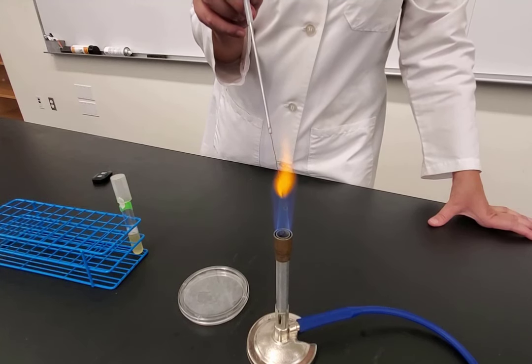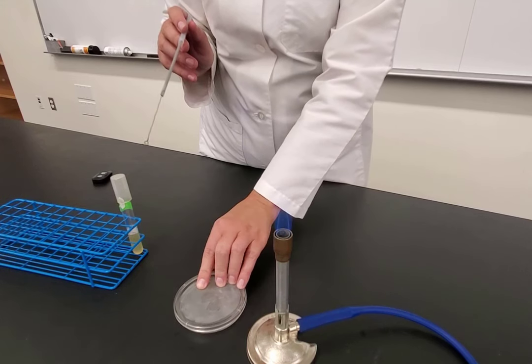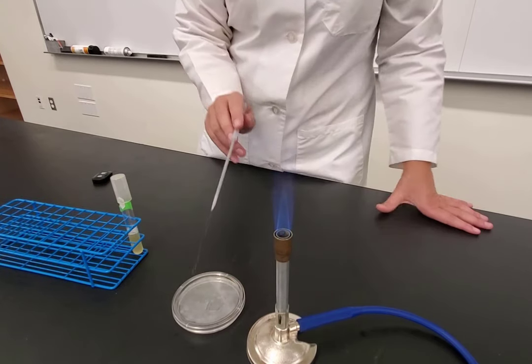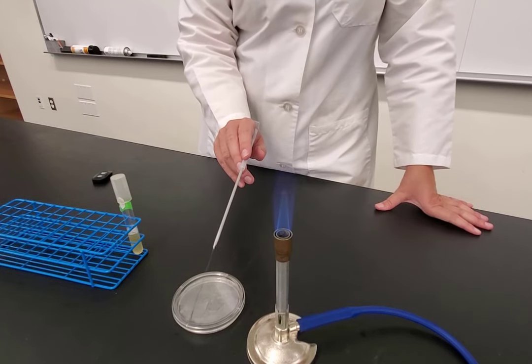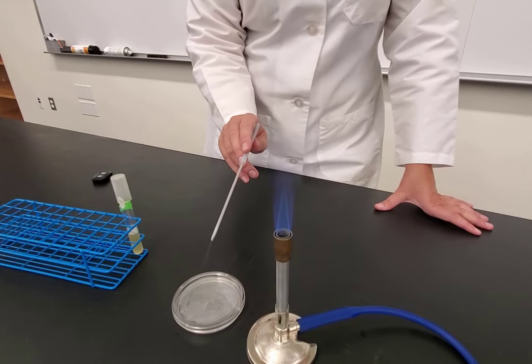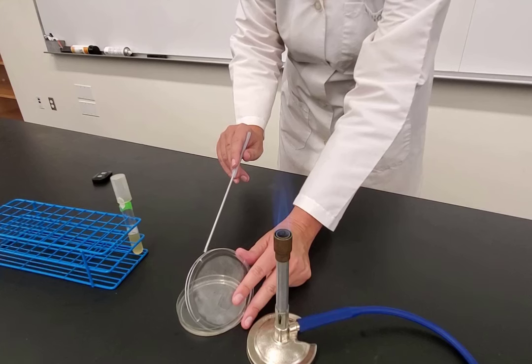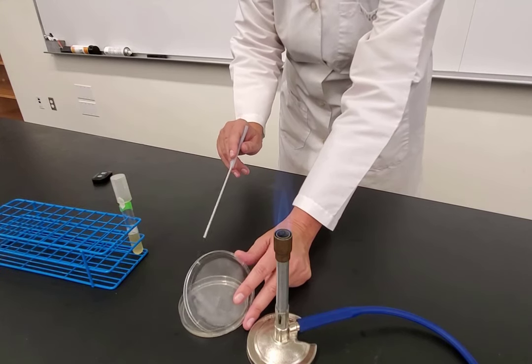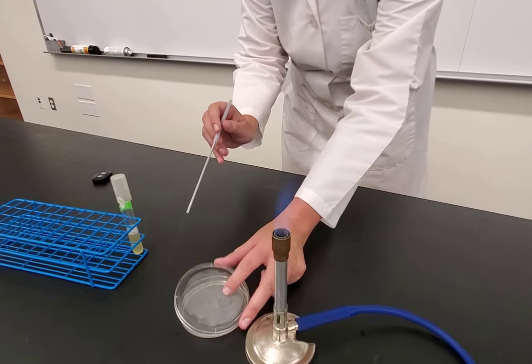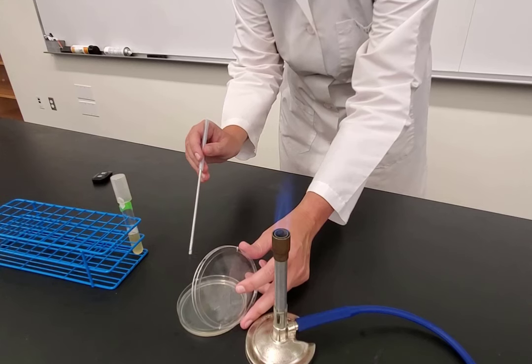After filling in quadrant one, flame the loop starting from the base working towards the tip. While it cools, rotate the plate 90 degrees — quadrant one, which had the line, is now facing the Bunsen burner. When doing streaks, always go side to side — never pull the loop towards you or push it. Touch the loop to the agar to confirm it's not too hot, then begin the 6 to 8 directional streaks.